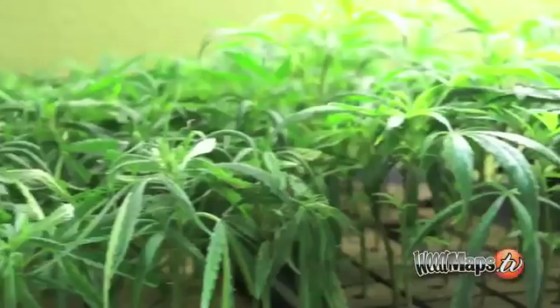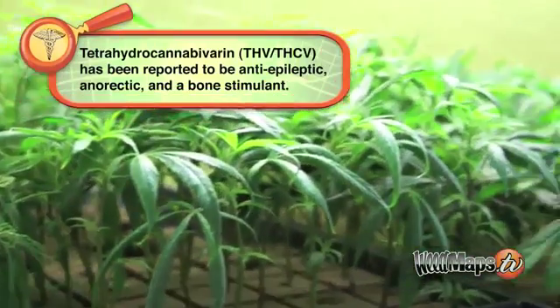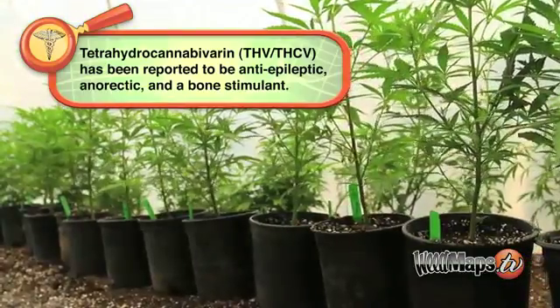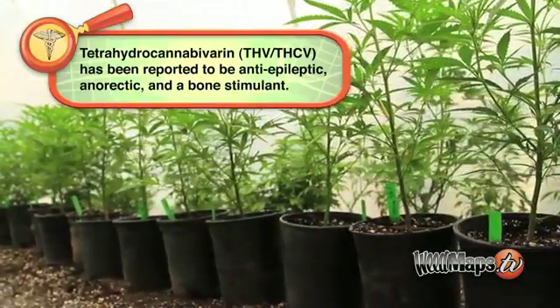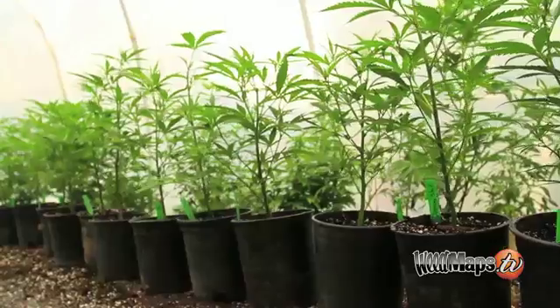And that's one of the things we do with growers. Through that, growers can very rapidly take a new strain that they're developing and within the first generation learn how to maximize what quality is about that particular harvest that they want.